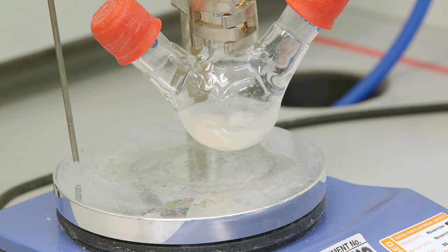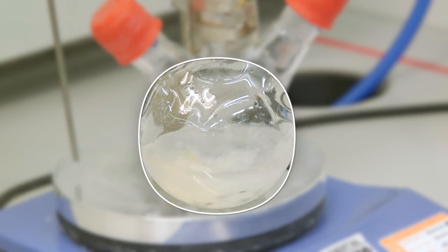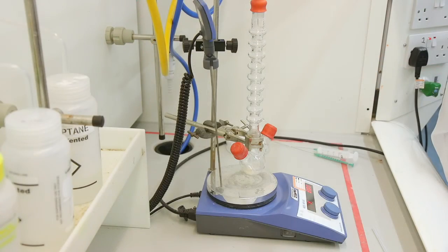The reaction can now be stirred. Effervescence is now witnessed from the reaction. Now we have added everything we will leave it stirring for about 10 minutes to ensure no extreme exotherm happens.